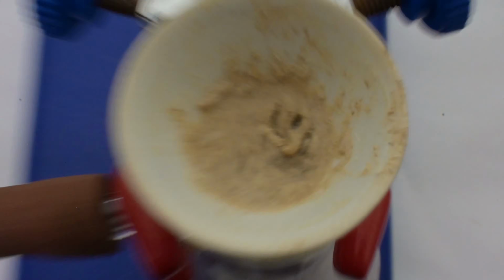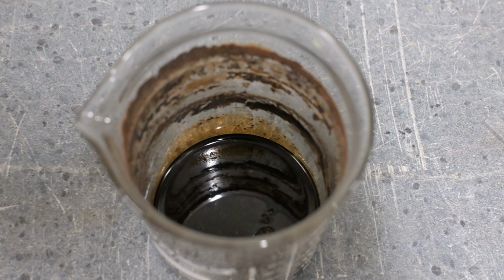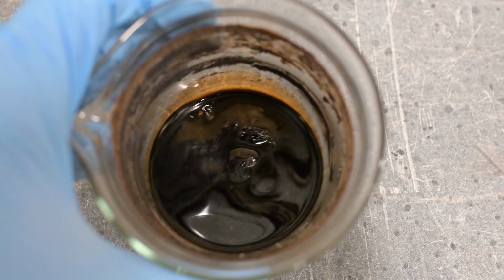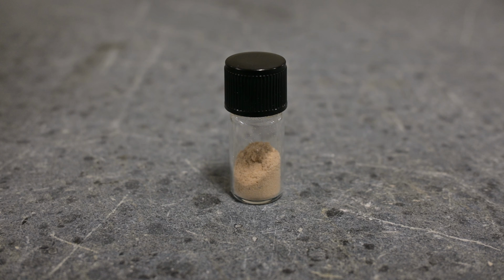After cooling, it yielded around 300 milligrams, about one-third of what we expected. Looking at the collected waste, there's a lot of solid material, most likely containing our missing product. Nevertheless, we did get a product. Now it's time for my favorite part, analytics.